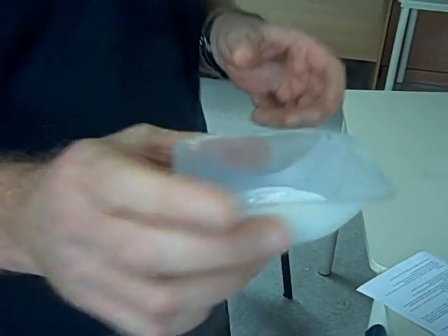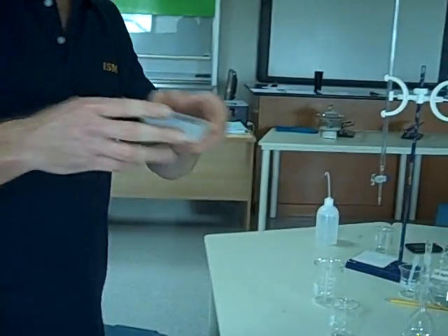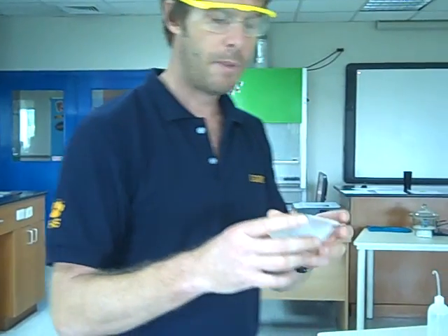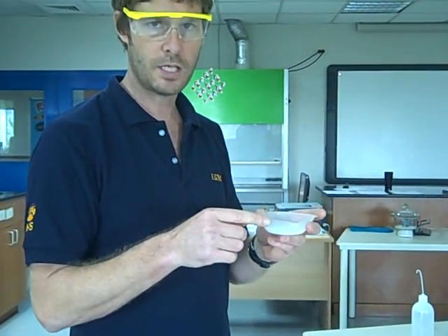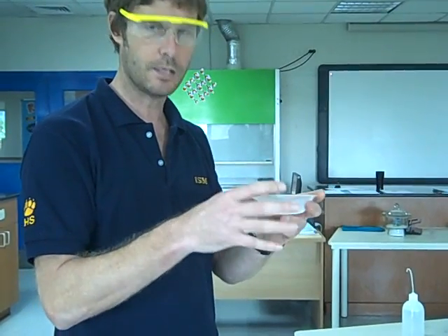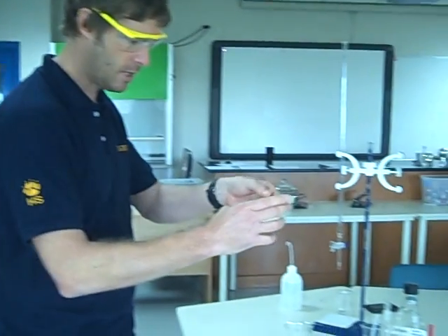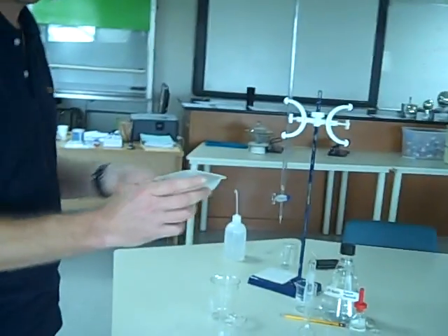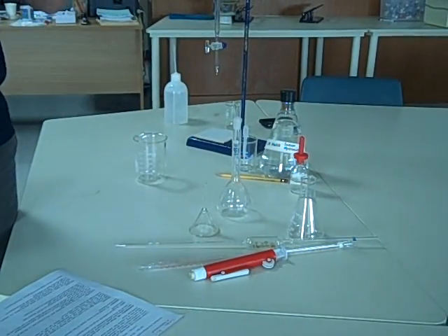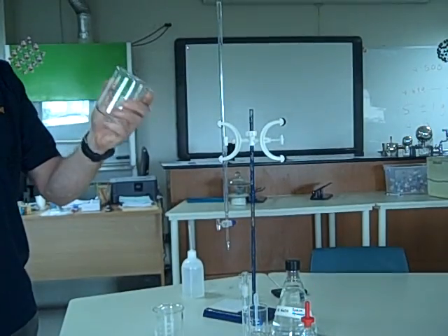I've done that already. I've measured approximately 1.5 grams into my weighing boat using a balance, but I do know precisely to three decimal places what the mass of both of these are, the weighing boat plus the acid. So the first thing I'm going to do with that is dissolve it in distilled water. I'm going to dissolve it in a clean beaker, first of all.